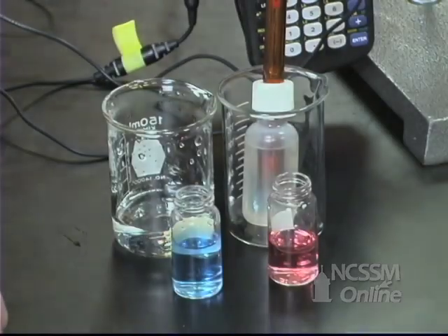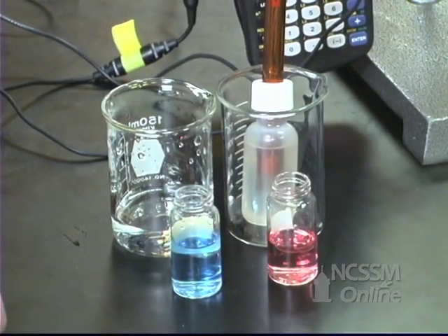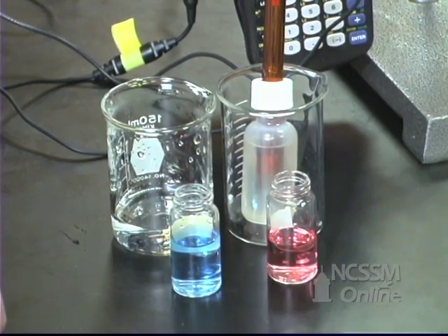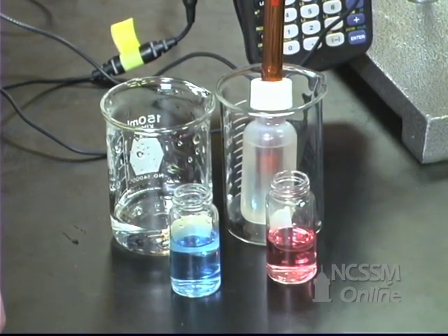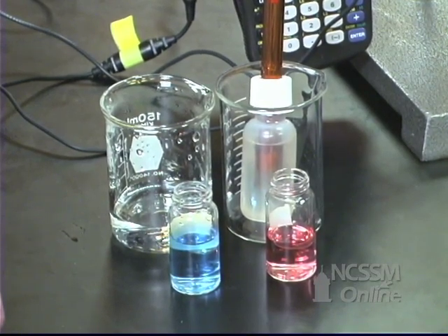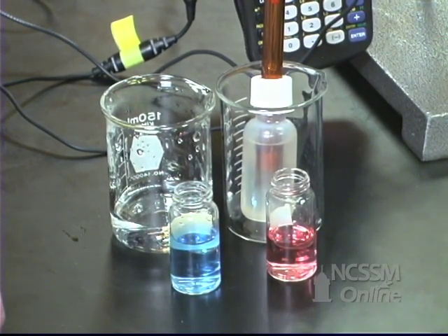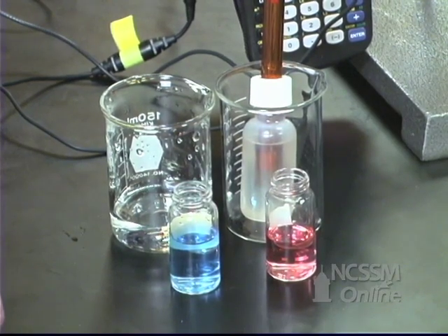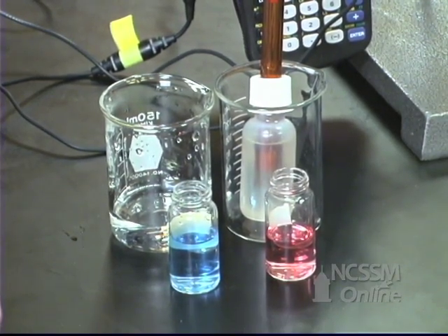We're going to determine the Ksp of calcium hydroxide and magnesium hydroxide. We're going to use a pH probe to determine the hydrogen ion concentration in the solution, which in turn will allow us to calculate the hydroxide ion concentration and in turn the calcium and magnesium ion concentrations.